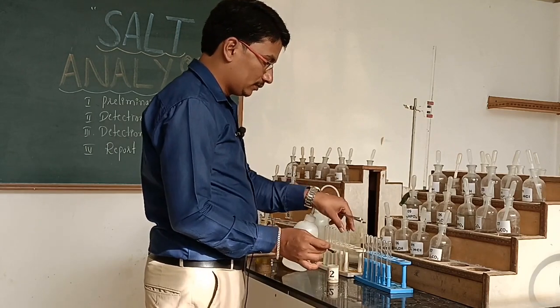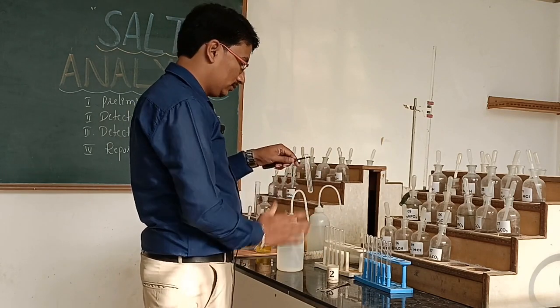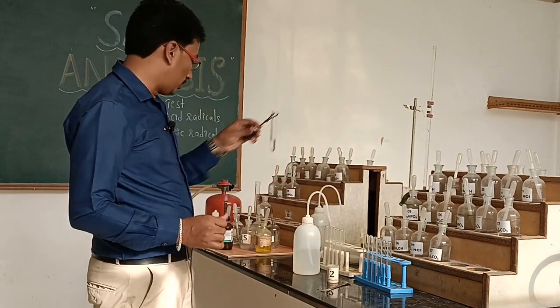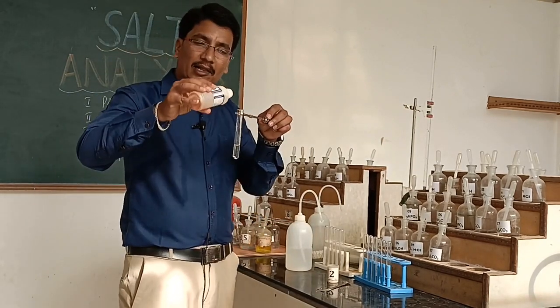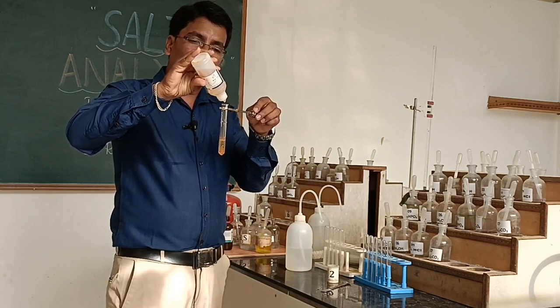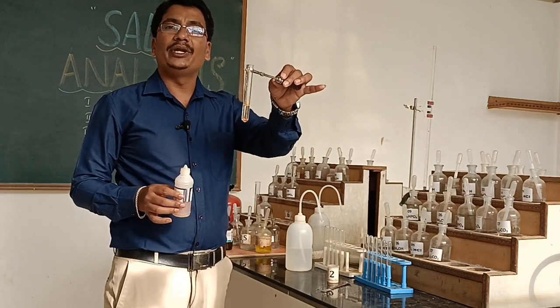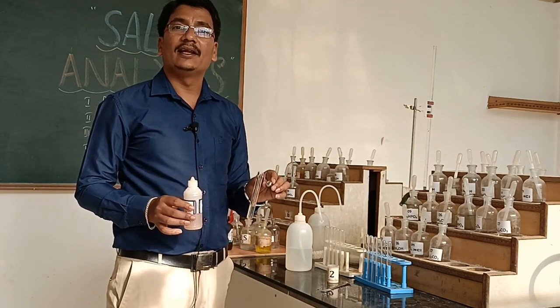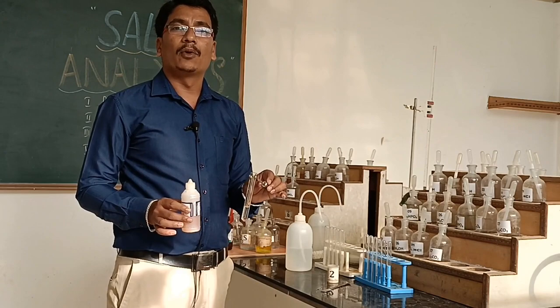For the Nessler's reagent confirmation test, we prepare salt solution using water. To the salt solution we add Nessler's reagent and observe a brown precipitate. This confirms the presence of ammonium ion. Hence, in the second salt, the acid radical is bromide ion and the basic radical is ammonium ion, so the given salt is ammonium bromide.